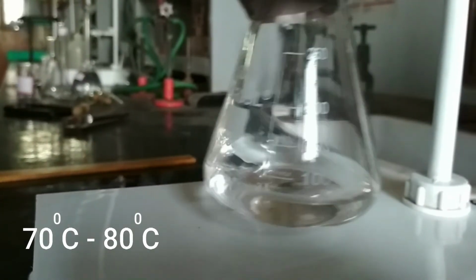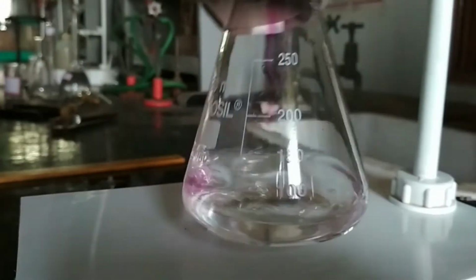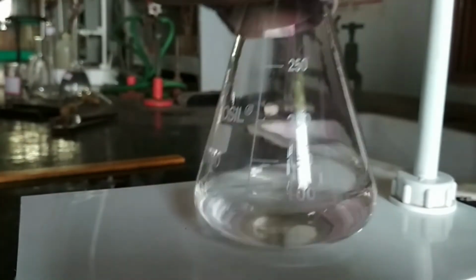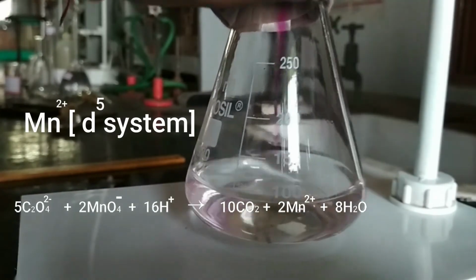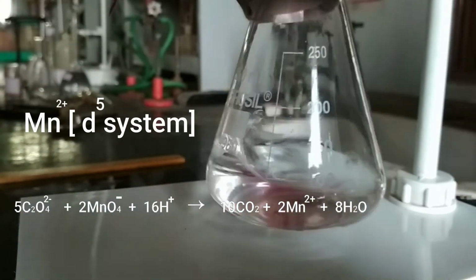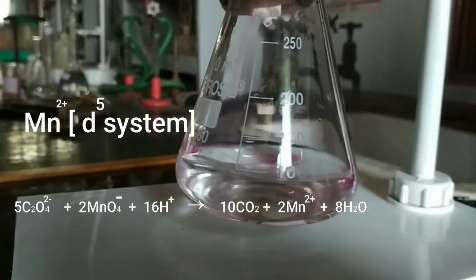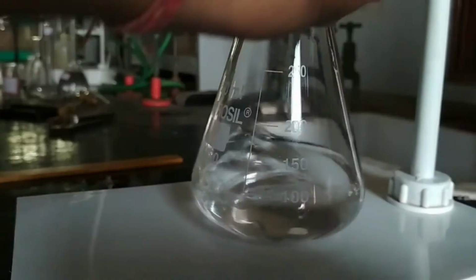Supplying heat energy as well as shaking the solution will provide mechanical energy to the system to initiate the above reaction and produce a few molecules of the product Mn2 plus at the beginning, which is nothing but a d5 system as shown in the above equation. As soon as this Mn2 plus is produced in solution, it now catalyzes the reaction and the rate of the reaction becomes faster.